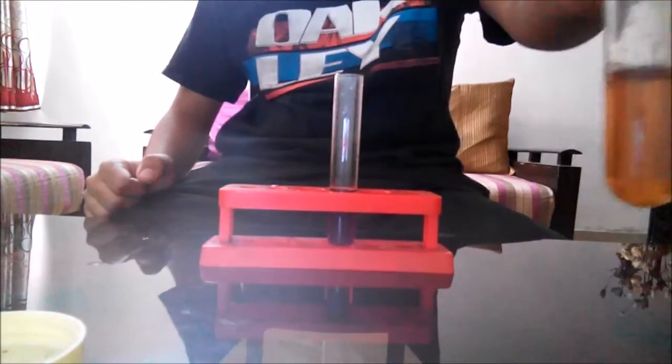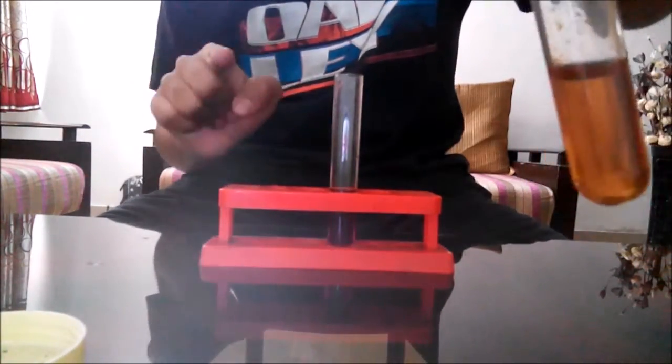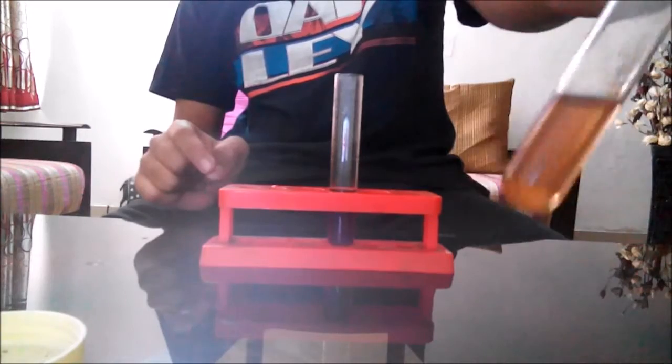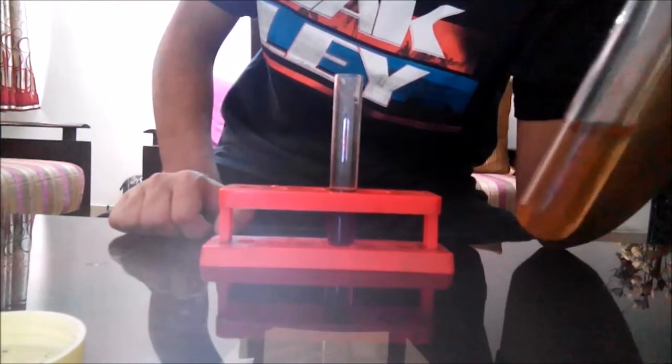Almost after five minutes you can see the color of this glucose solution—it was purple earlier and now it is of amber color. This shows that the potassium permanganate solution has oxidized the glucose solution. After a while you'll also notice that this orange color will disappear and a colorless solution will be formed.